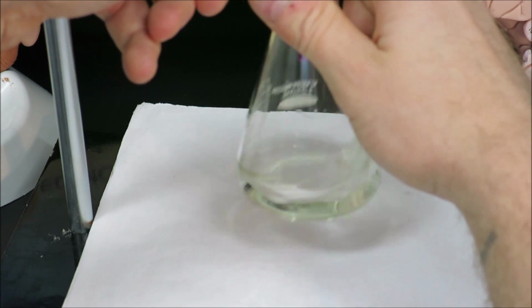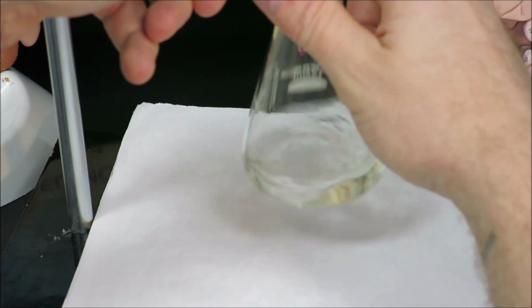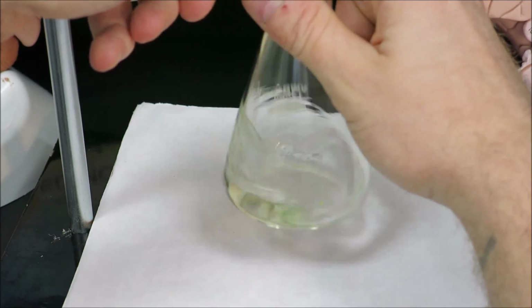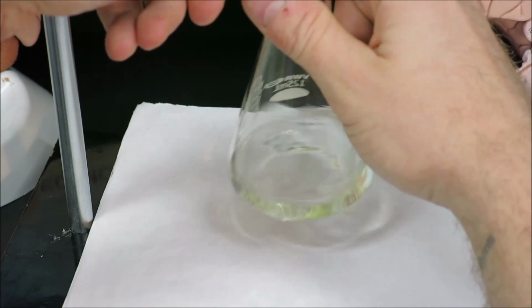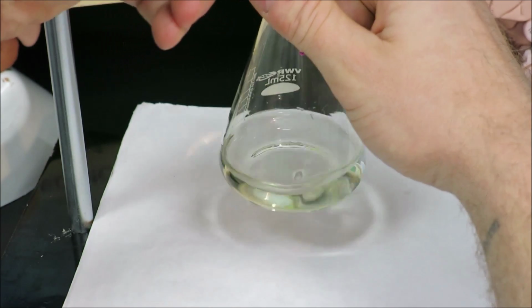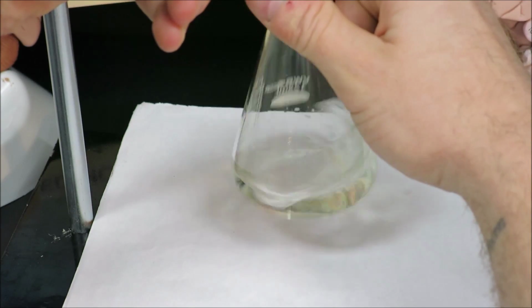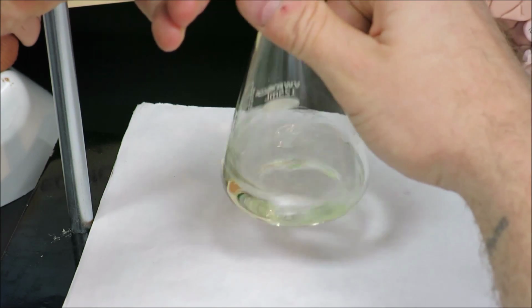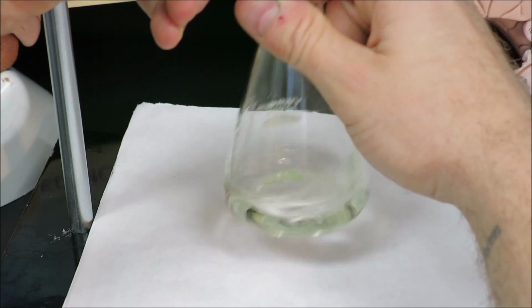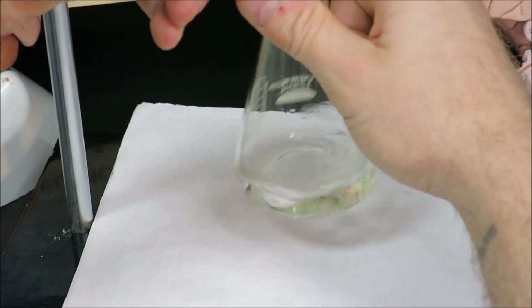And this will take a lot less time to get to our equivalence point because we've already added the majority of the volume required. Now this isn't to say it will be exactly 14.0 milliliters added like it was the last trial. However, we do know it should be near 14, and we've gotten the solution much closer to that. Again, now I'm not caring about the actual volumes, I'm caring only about the color, and I'm watching the time it takes for that color to fade. And I can see that we are indeed close, not that close quite yet, but very close.